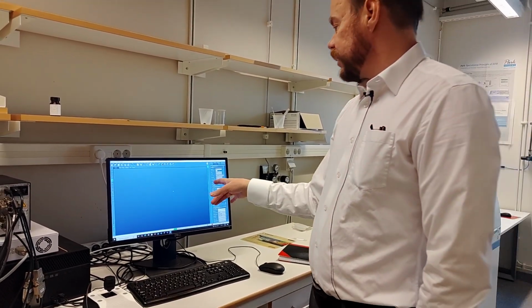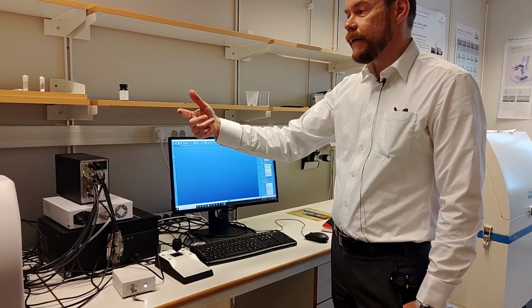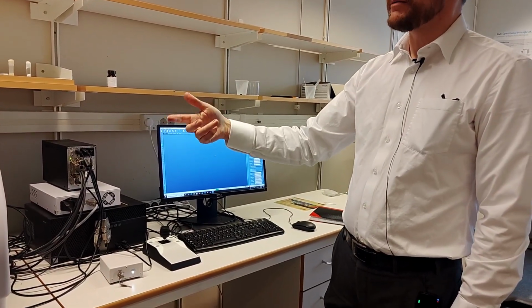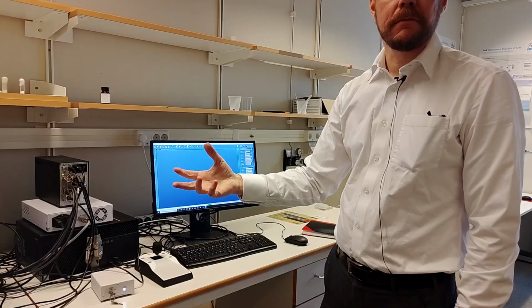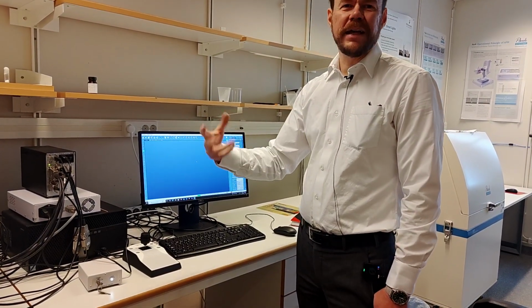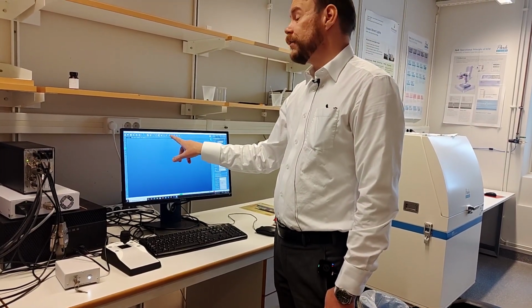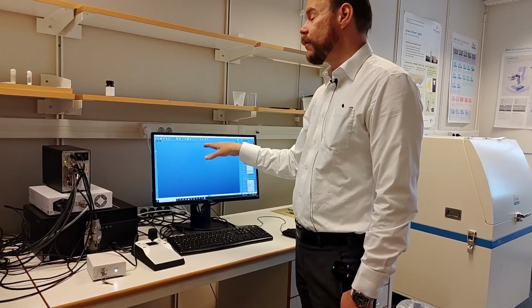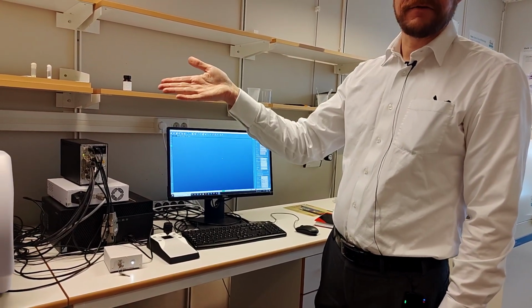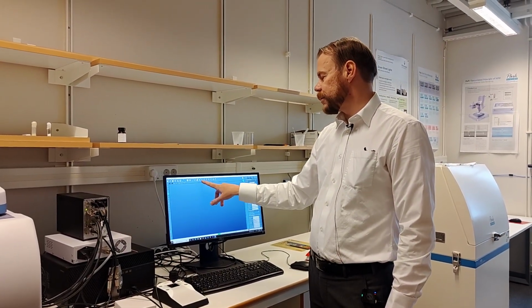And to run the spectrometer, we have two options. The play button just runs the spectrometer over and over again, in real time, and you see what's happening. And the record button is when you actually acquire a real spectra that you want to save. These color buttons, if you have several lasers, you can pre-program to do certain configurations and measurements based on the type of laser. But since we only have one laser, we don't use these buttons. We only use the main record button or the play button.